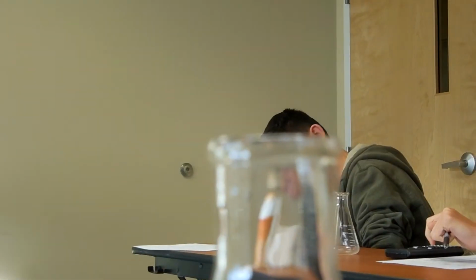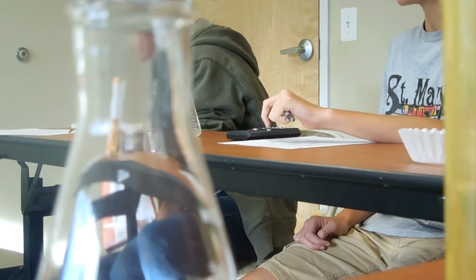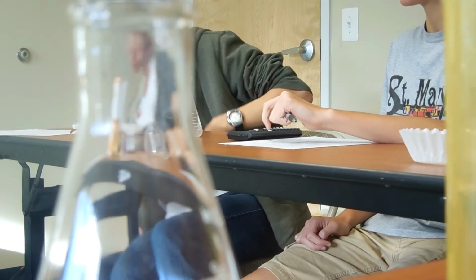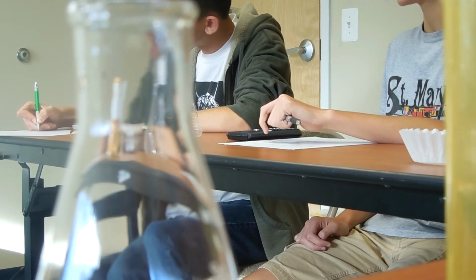Make sure that the coffee filter doesn't touch the sides of the thing, even if you have to rip the coffee filter down to make it fit. Oh wait, don't start measuring yet. We're not all going to measure the same amount. That would be silly. We could just do it once if we were going to do it that way, right? So don't literally start measuring yet. Let's think it through a little.